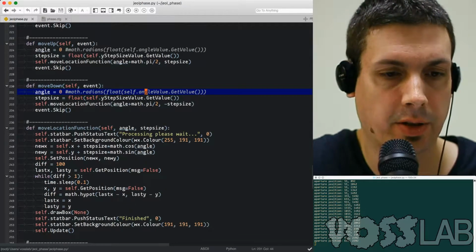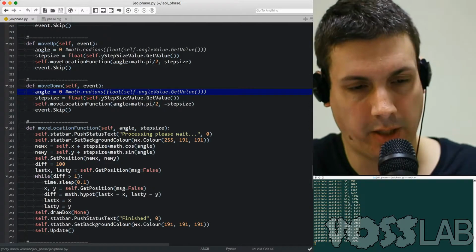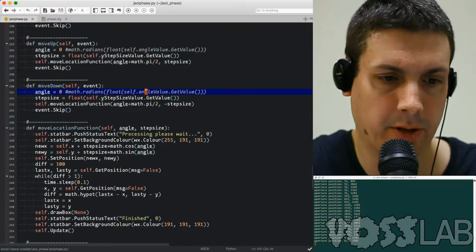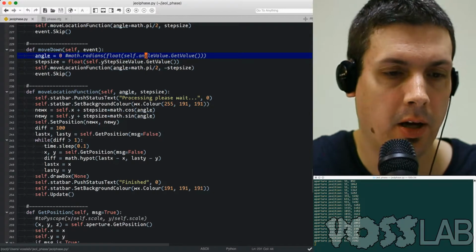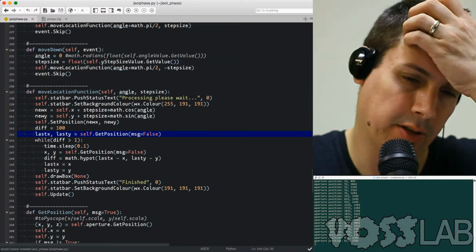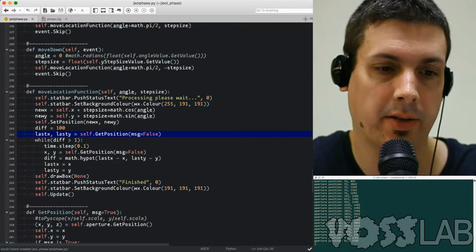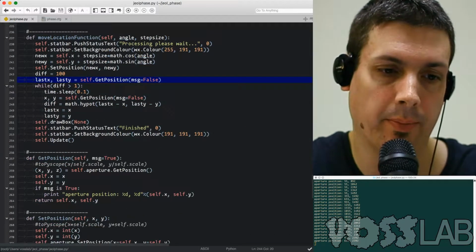And then the move location function, I do the cosine and sine here, but it's a lot simpler than before. And then I tell the microscope to set the position, draw the status bar. New code here, this is the code that checks the position to make sure it's actually gotten to the correct location. So it's just kind of measuring, has the position changed? Okay, I'll continue to wait before allowing the user to move again.